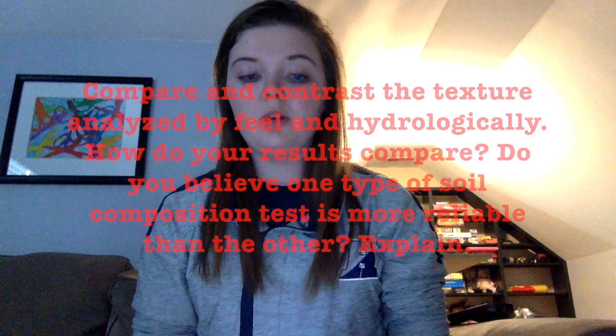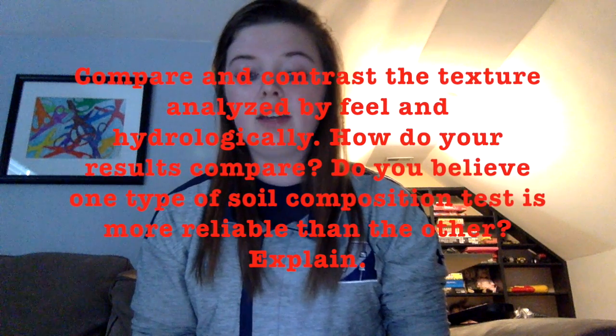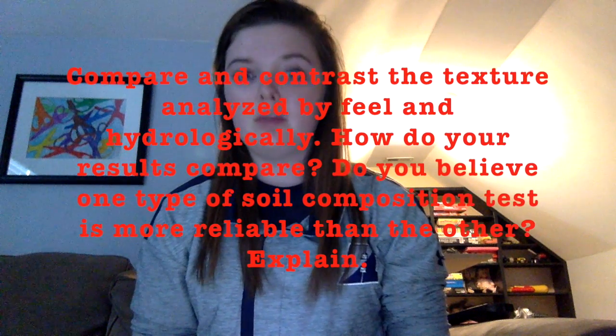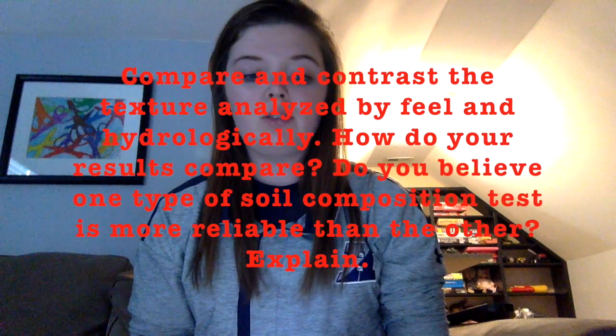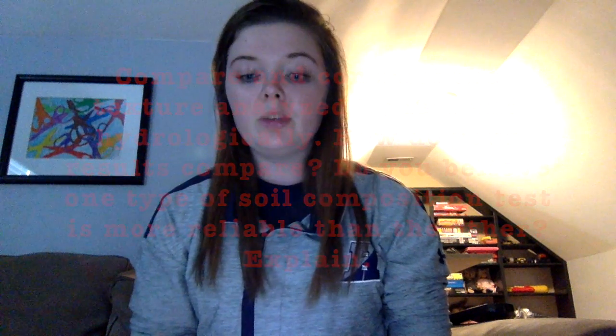Our results by feel were not as accurate as our results by the hydrological test. However, looking at it through the soil triangle spectrum, both tests were located around the same location. There were minor differences with the percentages in each soil type. By feel, we determined the percentage of clay to be 10%, whereas through the hydrological test, the percentage was 7%. This change in percentage applied to silt and sand as well.